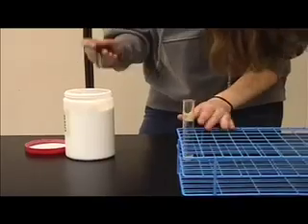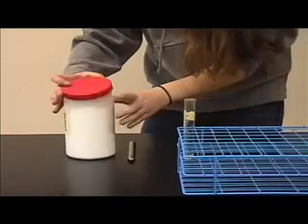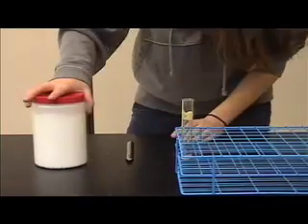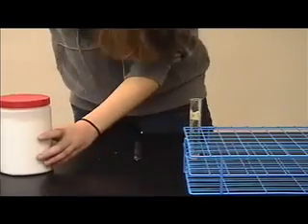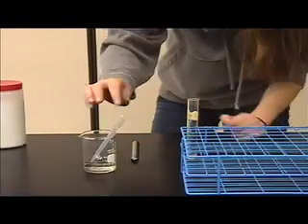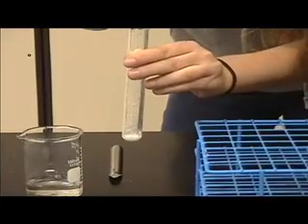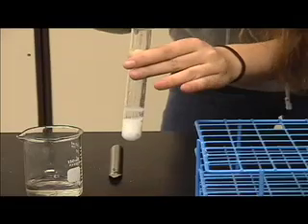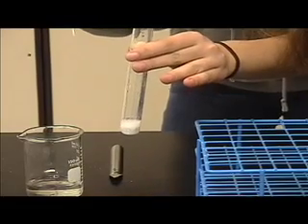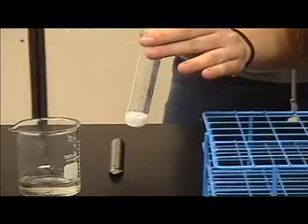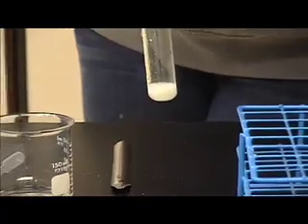Close up the jar, and then we're going to get our dilute hydrochloric acid. I already poured it into this beaker, and we're going to get a few drops and put it in. Now, as you can see, when you add the hydrochloric acid, a reaction is taking place. The solution is fizzing vigorously, and carbon dioxide is being let out into the air.